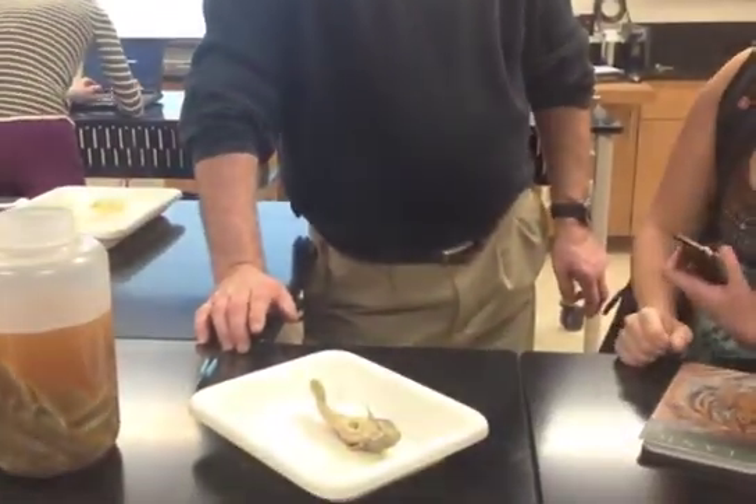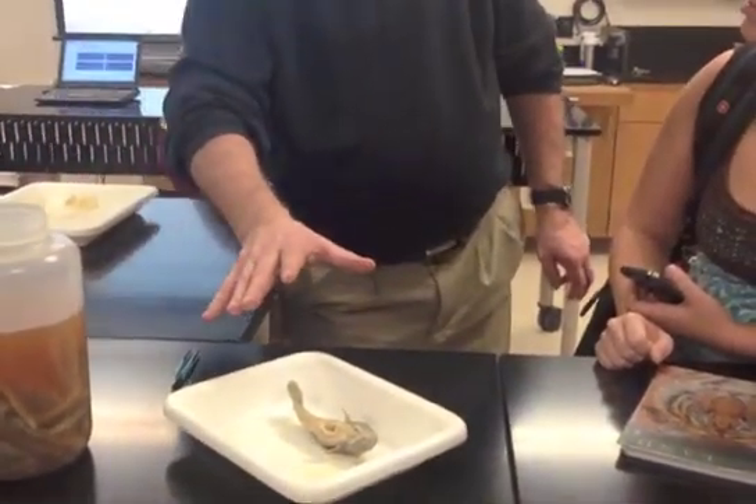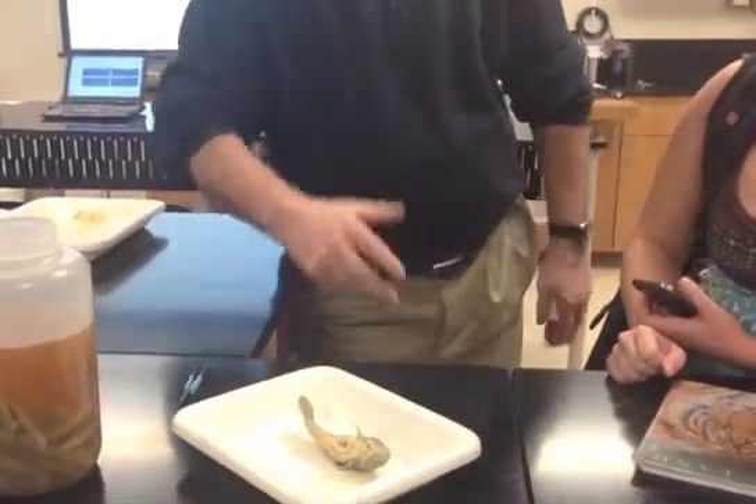What we'll do is record a residual. Let's say the specimen is dripping wet — we'd prefer you not use a dripping wet specimen; you can blot them dry gently with a paper towel. But if you pick it up and the scale says it weighs 0.12 grams, that's your residual. Write that on your data sheet, and take your wet weight minus your residual.